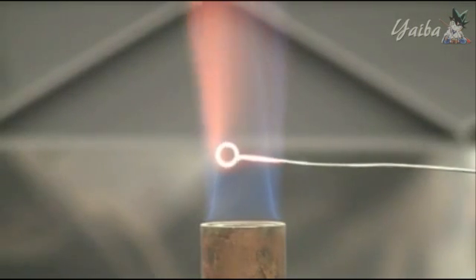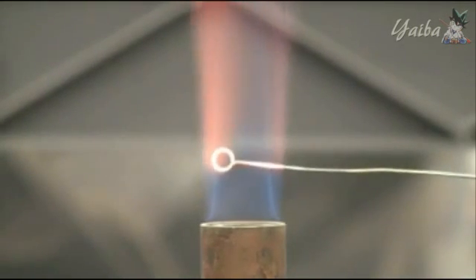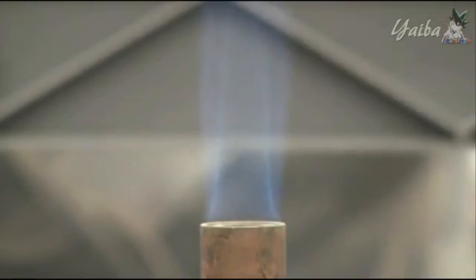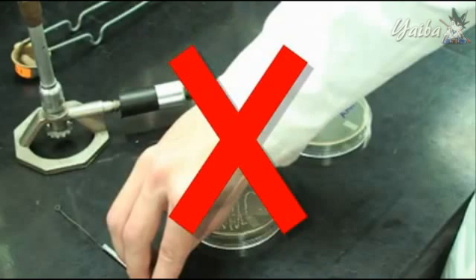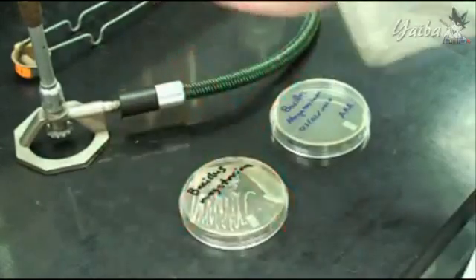You will have to flame the loop again after every bacterial transfer, so you can keep the burner going until you are done or, for any reason, leave your work area. Never allow the sterile loop to come in contact with any non-sterile surface, essentially everything. If it does, just simply sterilize it again.